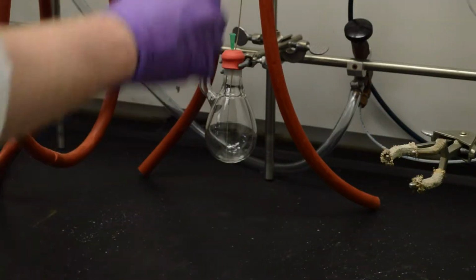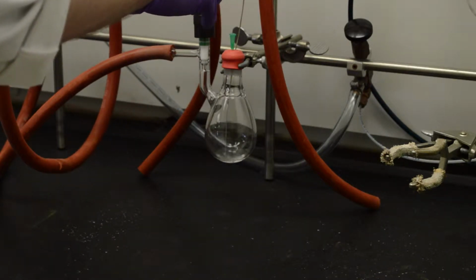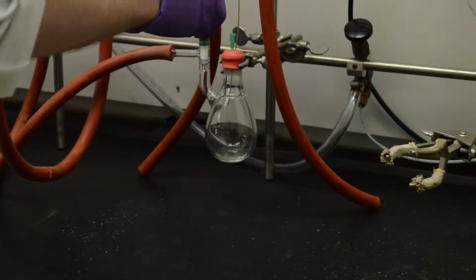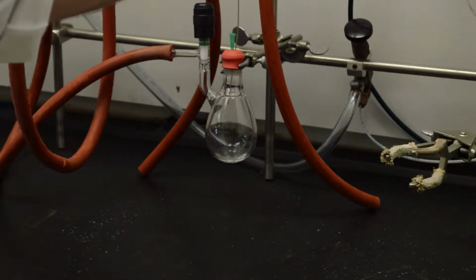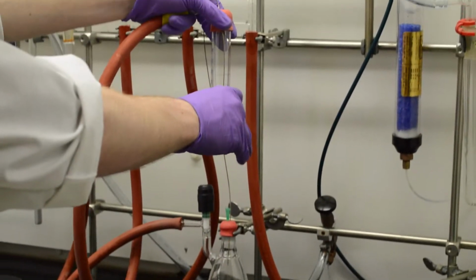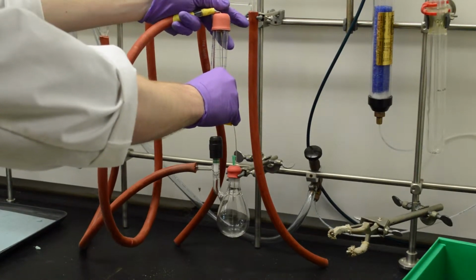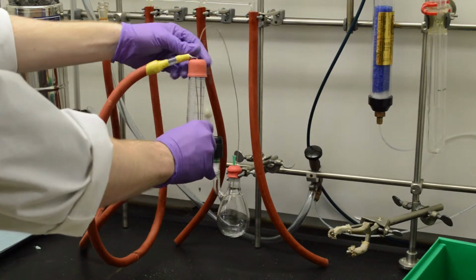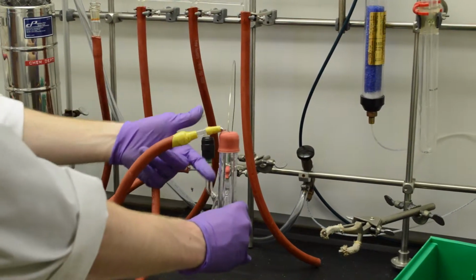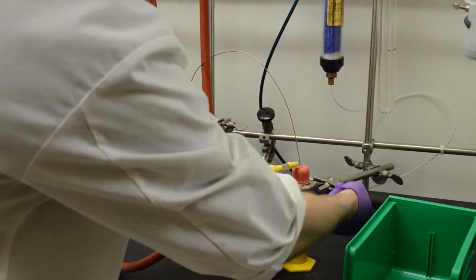So in your reactions, you're going to want to pour 15 milliliters into this. It doesn't need to be exact, but you can just sort of follow it along the graduated cylinder as it goes to make sure you get the right amount in there. So keeping it high up above the other should keep the flow rate fairly high. So once you think you've got enough, you can just pull this end of the cannula back out of the solution, but leave it inside the graduated cylinder.